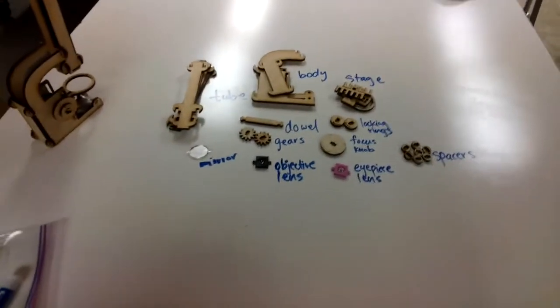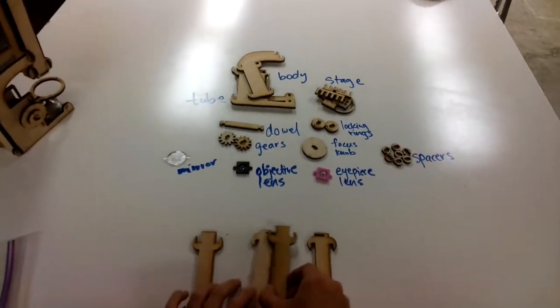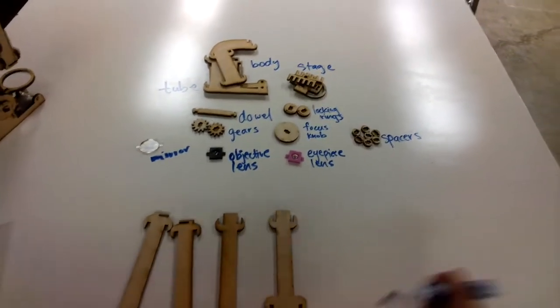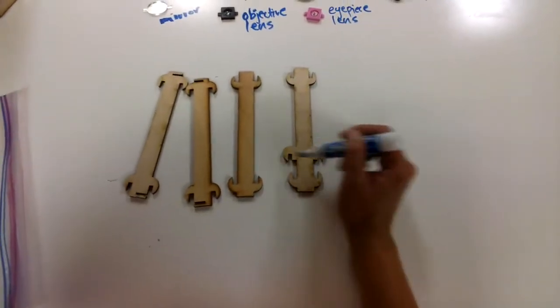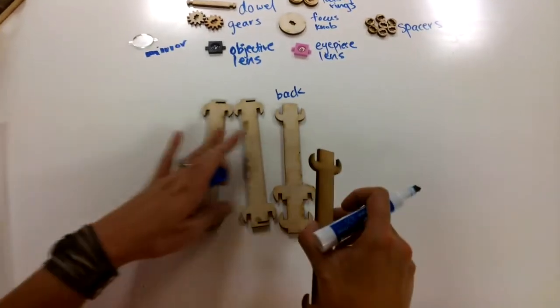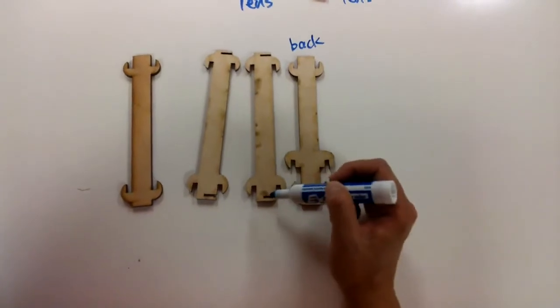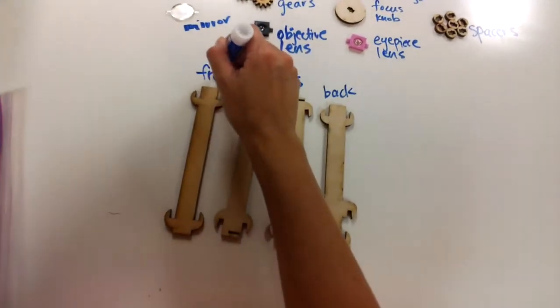So the first thing we're going to do is assemble the tube of the microscope. So take your pieces for the tube and we're going to lay them out. So first look for this piece that has kind of hooks on the top and hooks on the bottom, as well as a hook in the middle. This is the back part of the tube. And then you want to find 2 pieces here. The 2 pieces with these little slots on top and bottom, these are the sides. And then the last piece is the front.